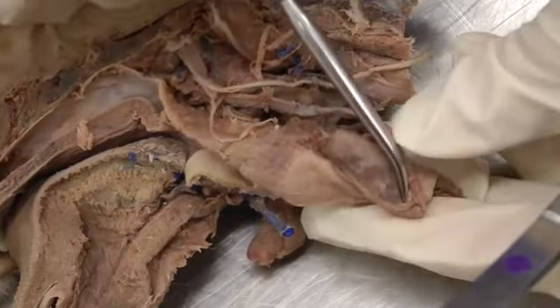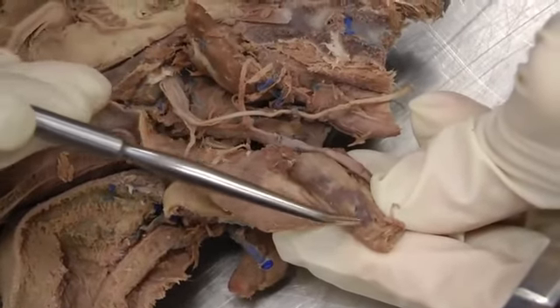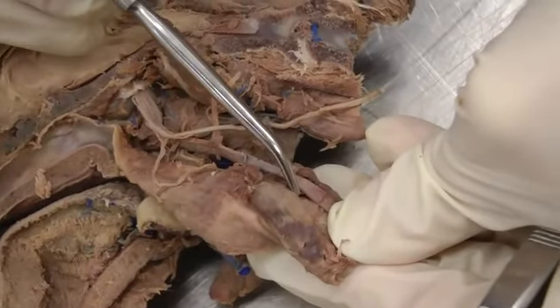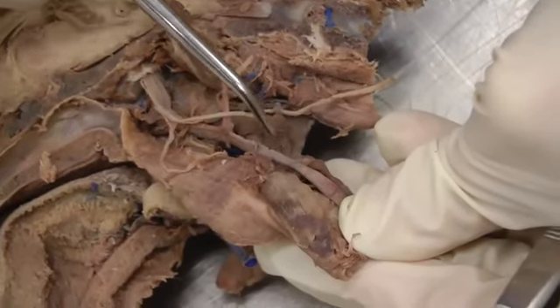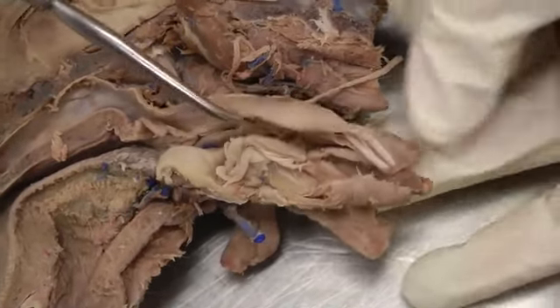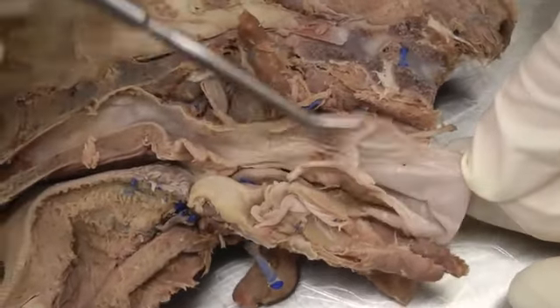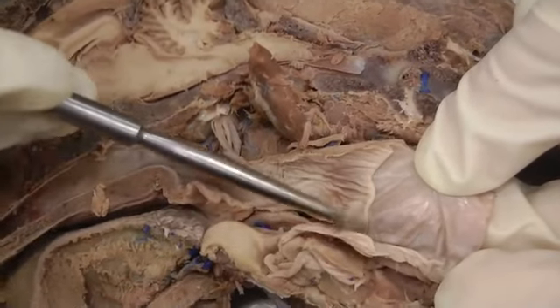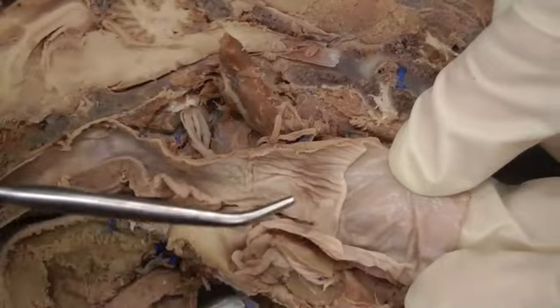And so here we have our thyroid gland, at least one lobe of our thyroid here. And we actually have an external parathyroid, this oval, lighter colored body right here. Okay, then here we have our esophagus, which we covered before and we've cut open. So esophagus has been split open. And we have the pharyngoesophageal limen right here, the differentiation between the pharynx and the esophagus.